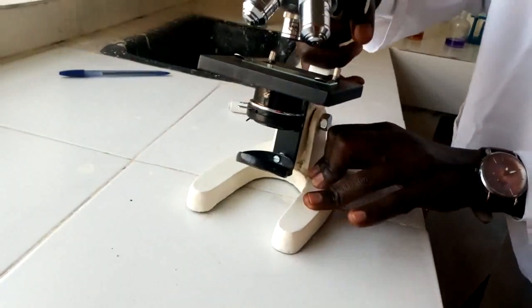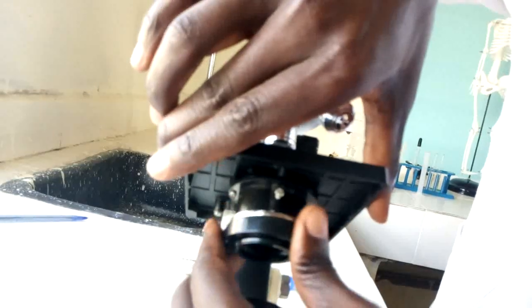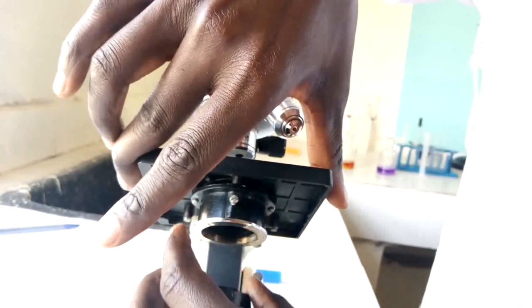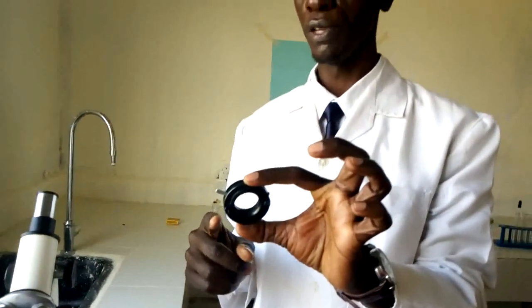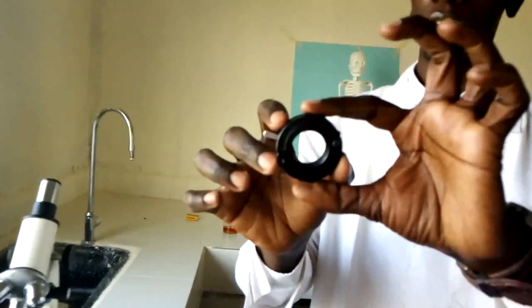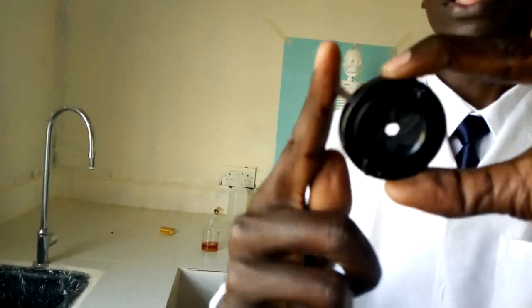We also have the part referred to as the diaphragm — let me remove it so we can have a look. The diaphragm is an aperture which is used to regulate the amount of light passing through to the stage. The diaphragm can be closed or opened. When there is too much bright light and we don't need a lot of light, we can close the diaphragm and leave a very small opening to allow only a small amount of light through.